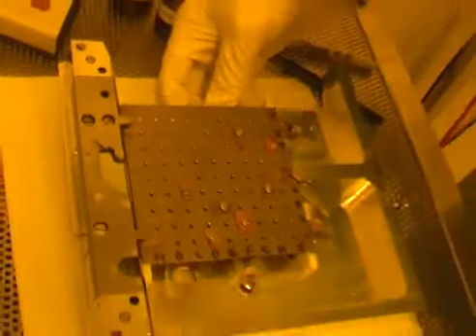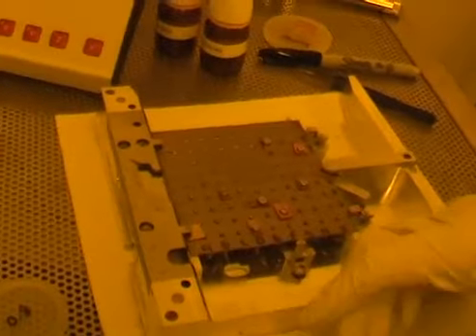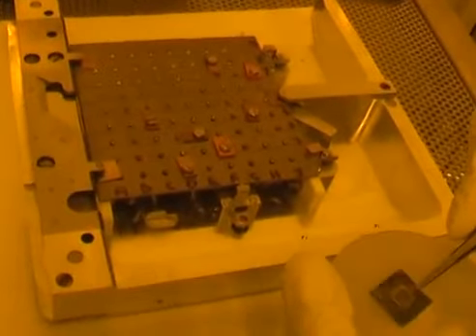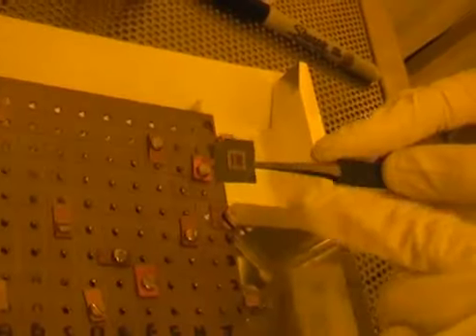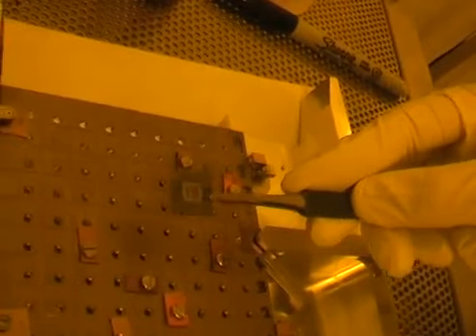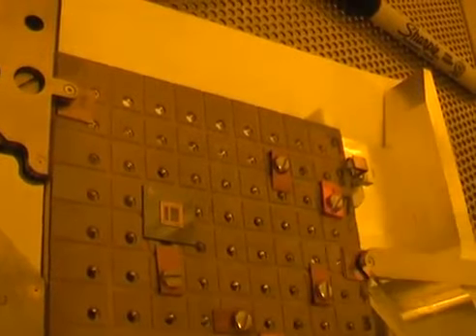Now, the reason for having that diagram there is because this is the orientation it comes into the alignment microscope later. So if I leave it here at that orientation, so I don't change it, I now know that my cross goes at the top left corner. And this is a very important part of loading, that we get it around the right way. Because it's nicely put together, I know I can hold it around the edges without causing any damage for a sample like this. So I simply need to put it somewhere. This clamp is going to be suitable, and I need to clamp it up.